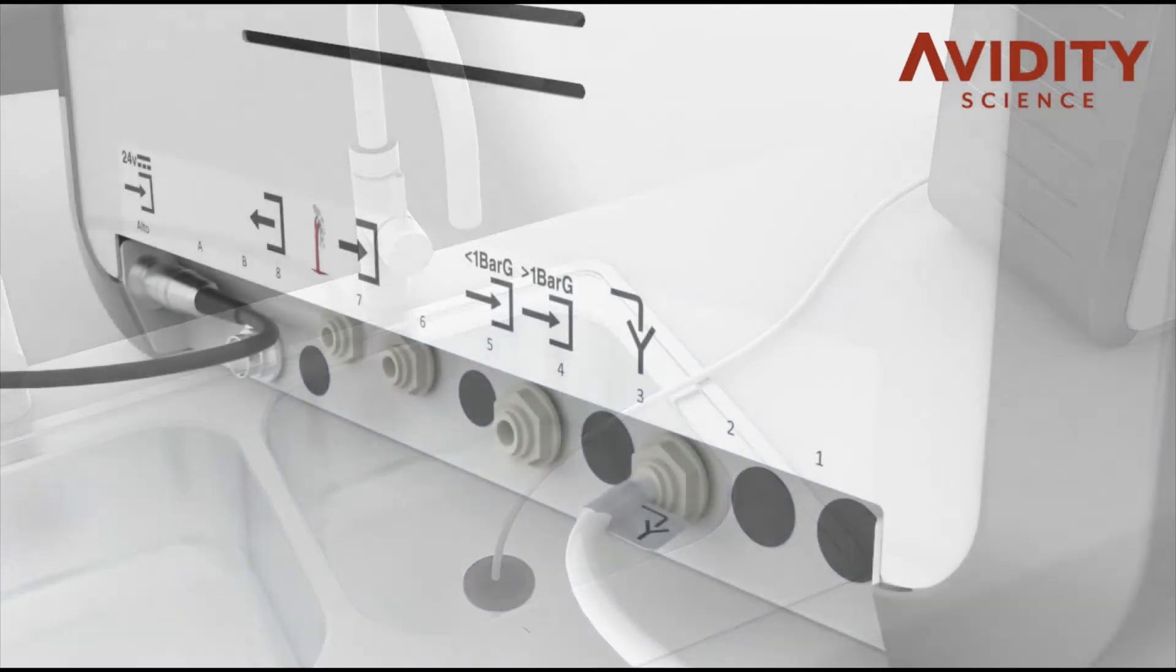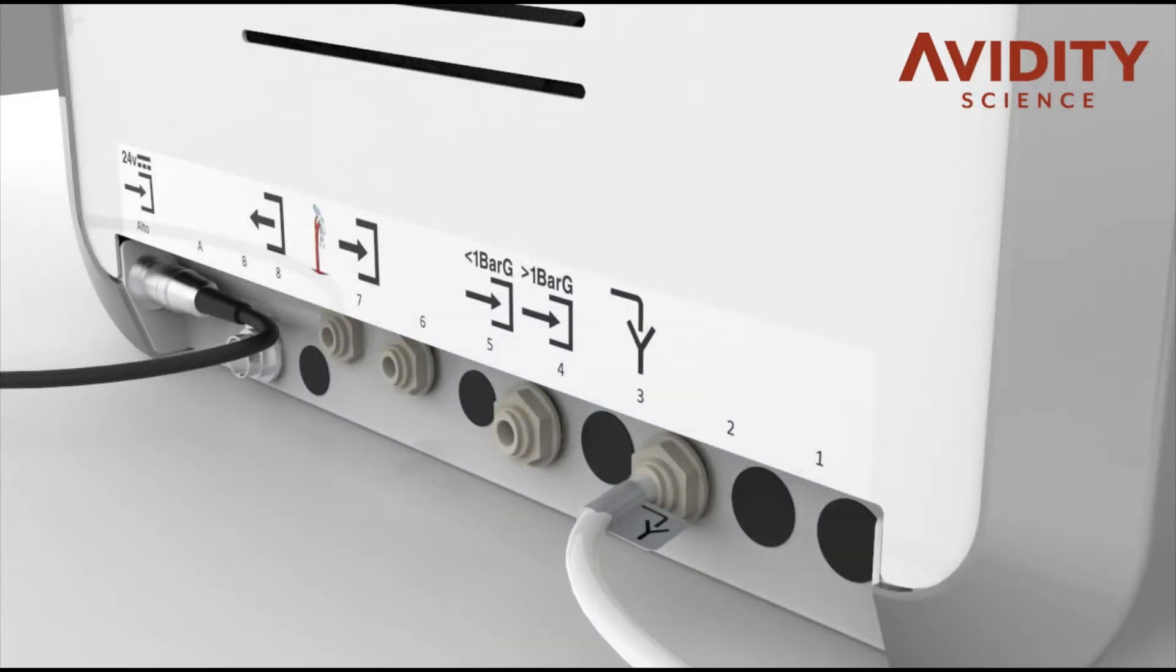Connect the pure water supply tube to the system, selecting pressurised feed or gravity feed depending on the source.